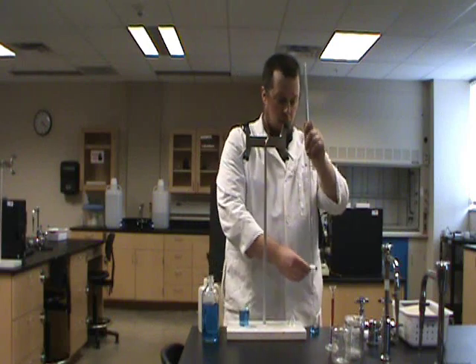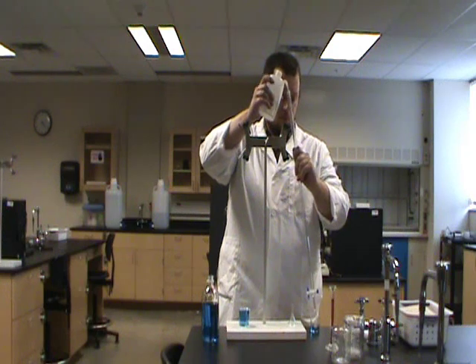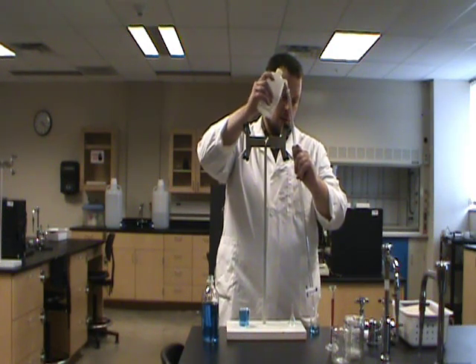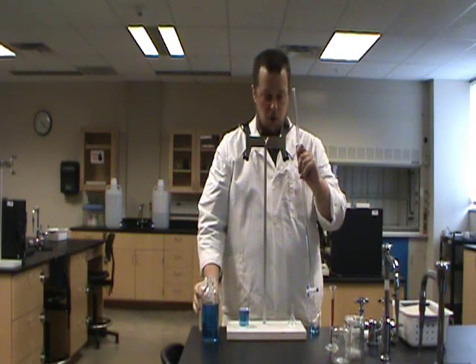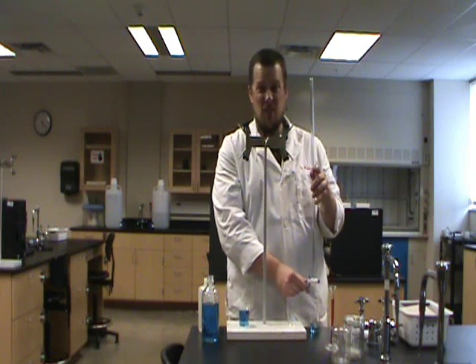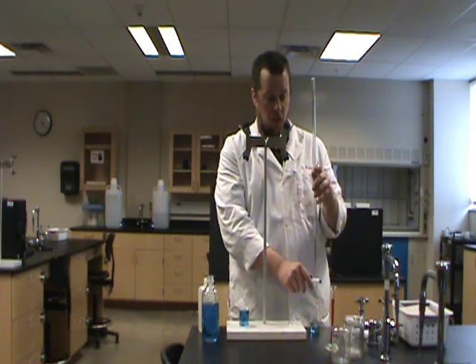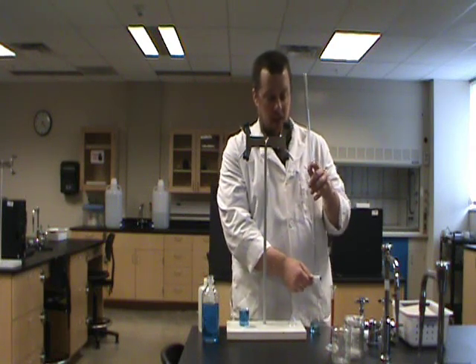And if you leave the tip open, you could do this at a sink. But if you leave the tip open and just rinse it out with deionized water, you should be able to do a pretty good job of getting it cleaned out. The nice thing about jet tips is they allow you to dispense very small amounts very readily, but the problem is if you're draining a whole burette it takes a long time.